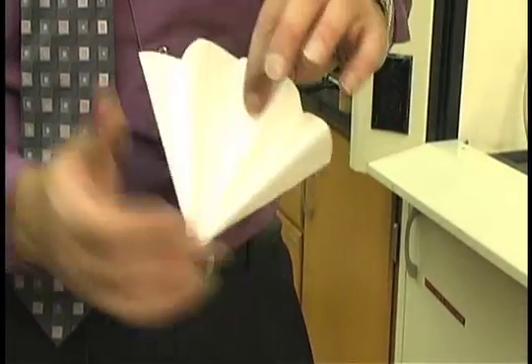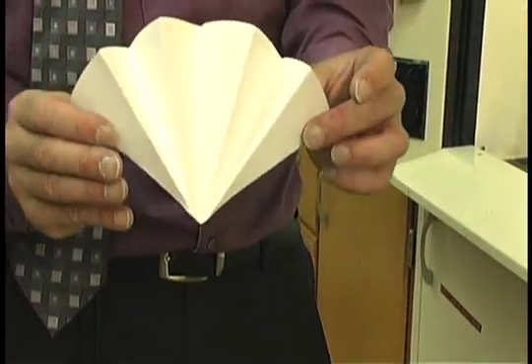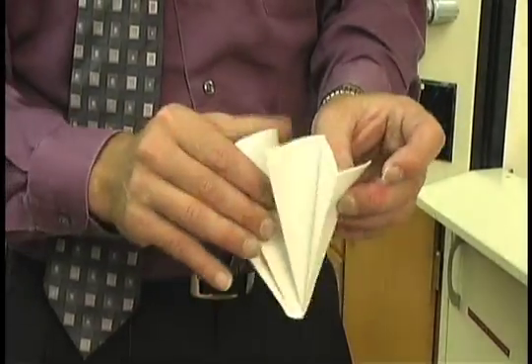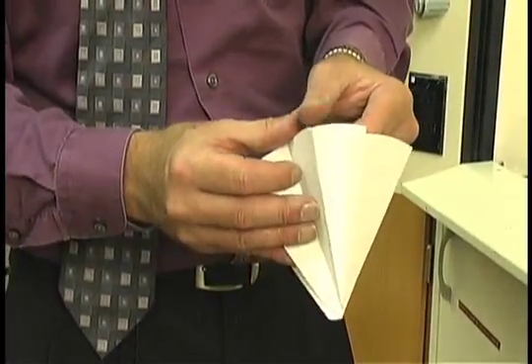Open the filter paper. It should look like a fan, and if you open it, open it entirely.